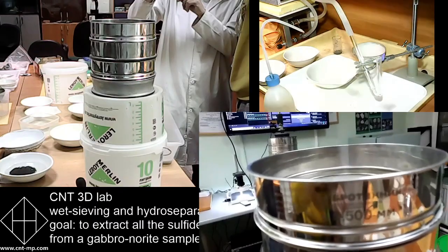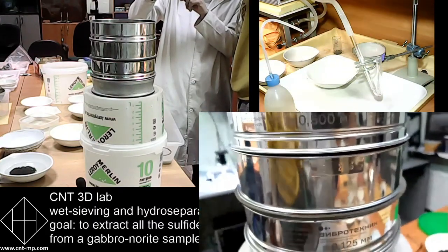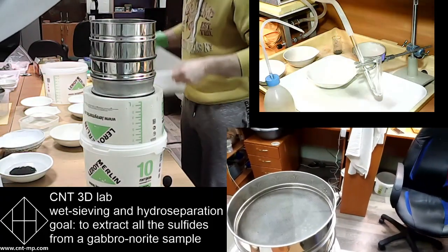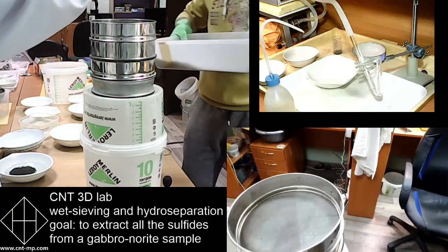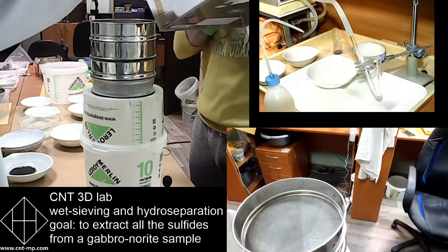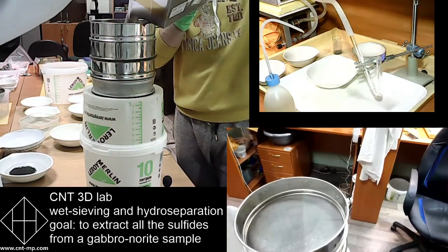So the sieve size on the top, this final one, the finest one, how big is this? Alrighty, now you can see everything. You can see from the side, you can see from the top. Anyway, so that's the sieve from above.